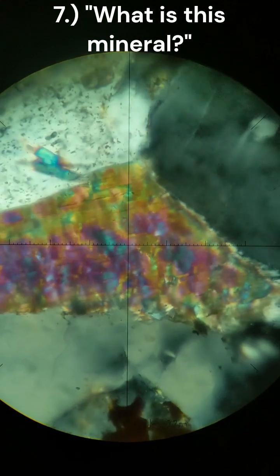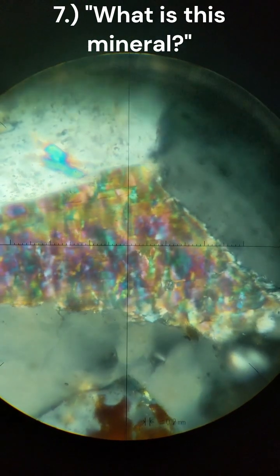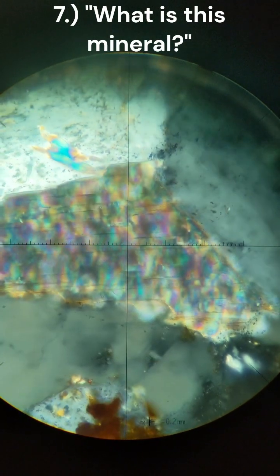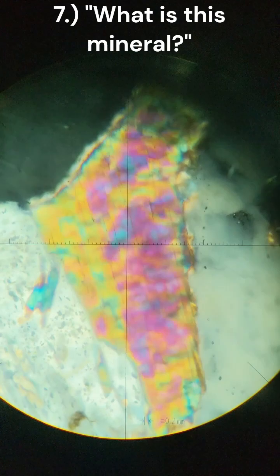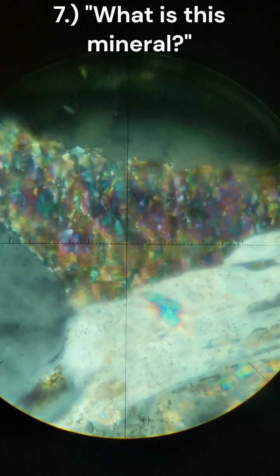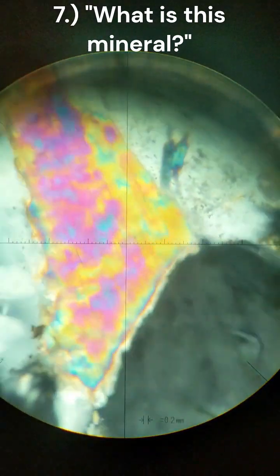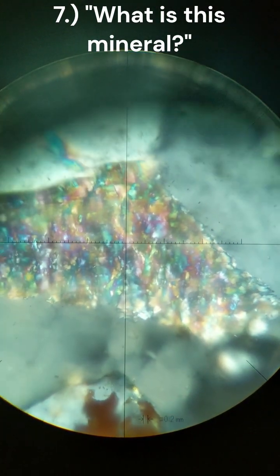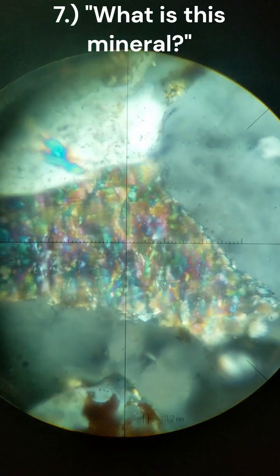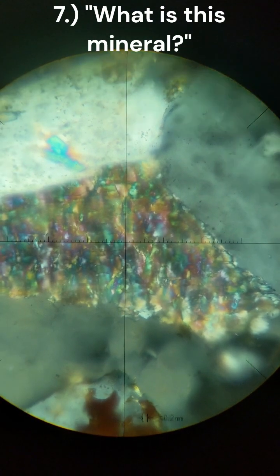You can put it at 0 degrees right now for rotation. 90-degree rotation counterclockwise. Another 90 degrees, we're at 180 now. And 270. Back to 360. Looks like maybe 4 what could be extinction angles.